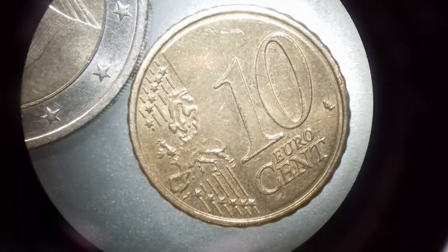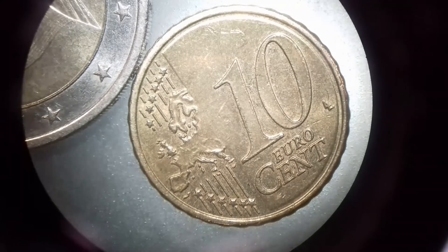Here I'm placing a 10 cent coin and simply also demonstrate the same thing.